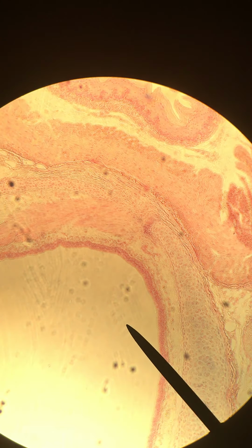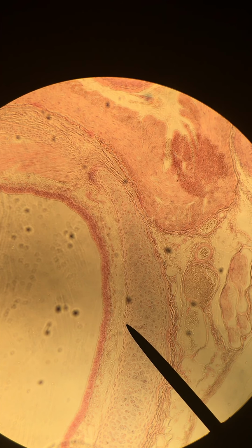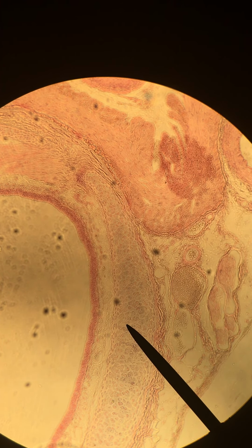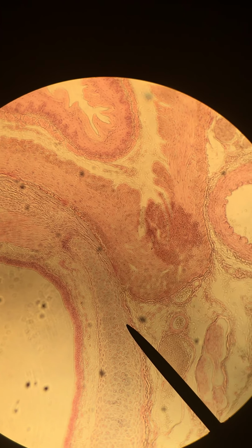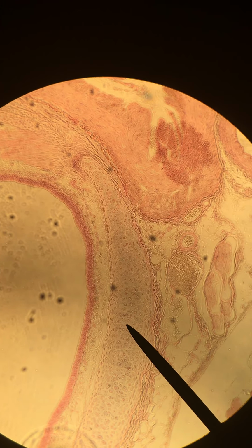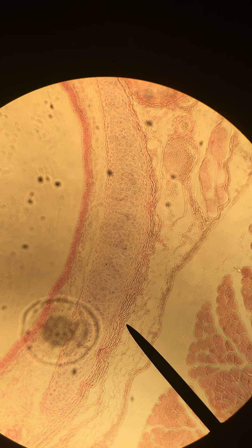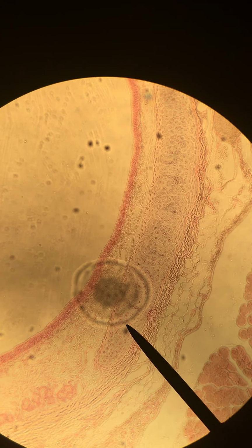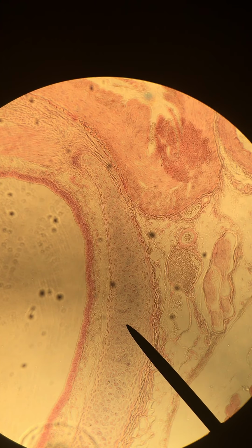Okay, and I would like to next look at our hyaline cartilage. We're right here actually. So the hyaline cartilage is surrounding the trachea. Okay, so I'm moving the pointer across it now. We're going to zoom in and take a closer look so you can see better what we're looking at. But it forms sort of arms that surround the trachea in this area here. Okay. All right, so let's zoom back in.